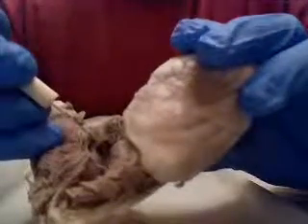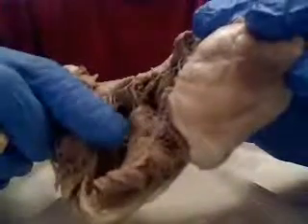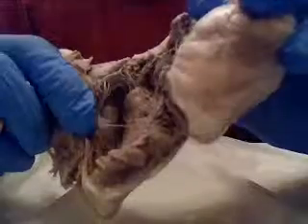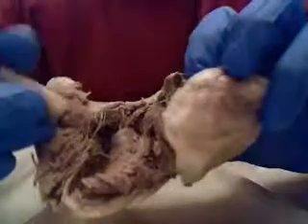And these are these little stringy things coming out of it. These are called the chordae tendineae, and they leave this and they connect down into the right there. Let me get a better look at it. Push this aside. Right there, which is called the papillary muscle, where my index finger is at right there. That's called the papillary muscle. Now, right down here, through the center, this big thing jutting out, this is called the interventricular septum, and what that does is it separates the right and the left ventricles over here.